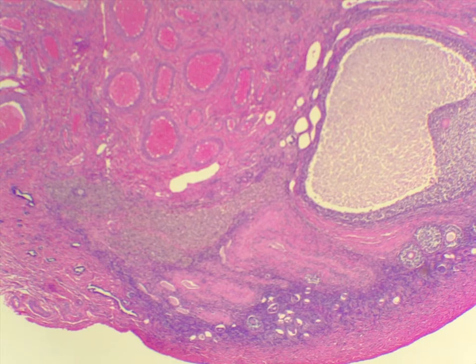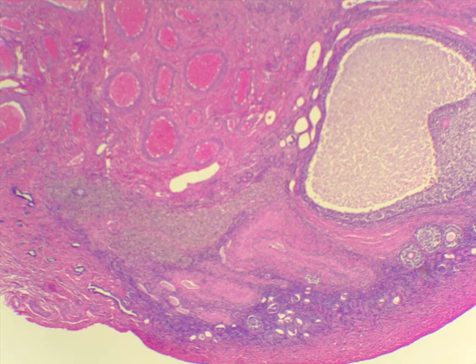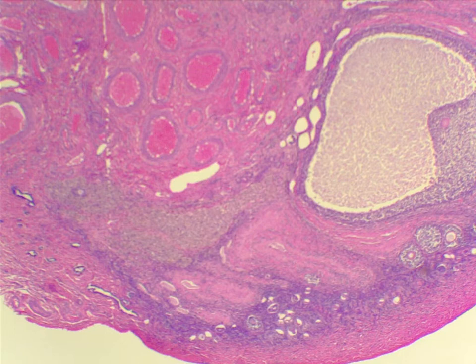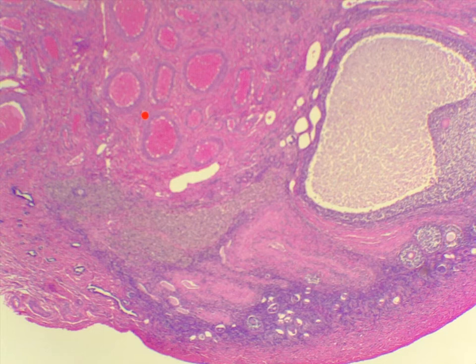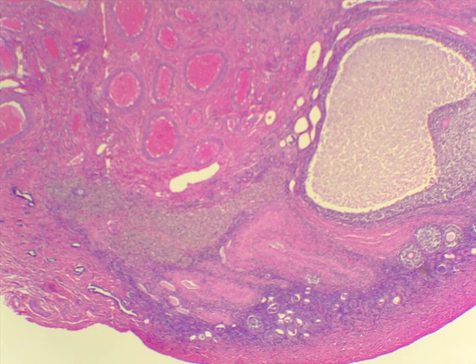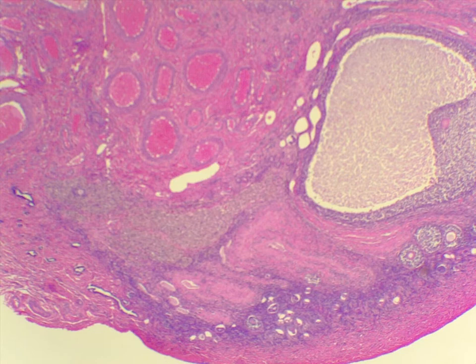This ovary is an example of a monkey ovary. The previous ones with numerous eggs were actually cat ovaries, since cats have many eggs being fertilized at once. Monkey ovaries are probably more similar to human ovaries, because humans have far fewer babies at a time — so there may be only one egg and maybe one follicle at any given time, as it takes a long time for one to mature and be ready to release.